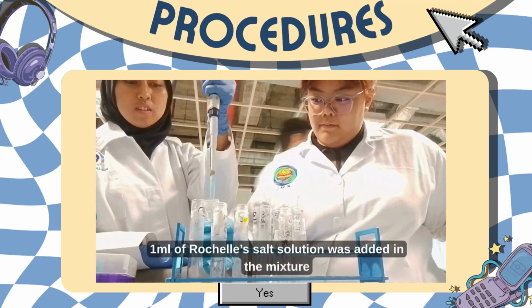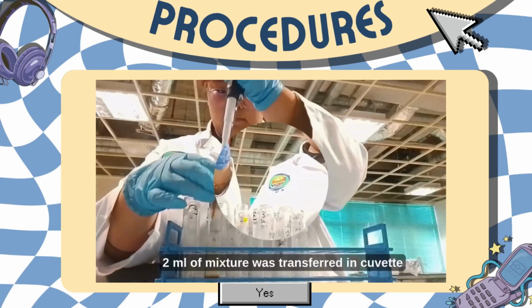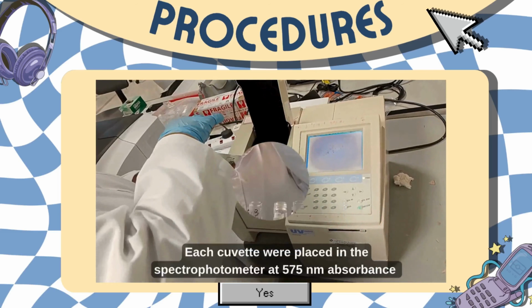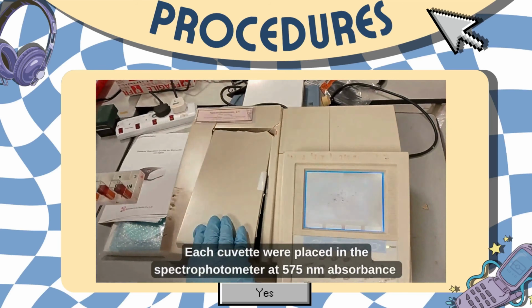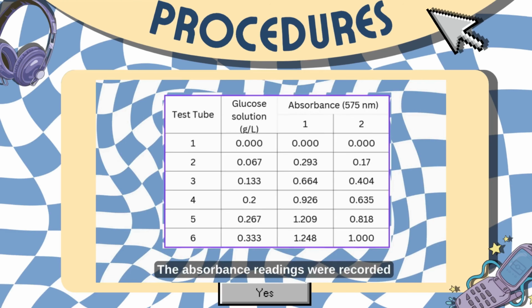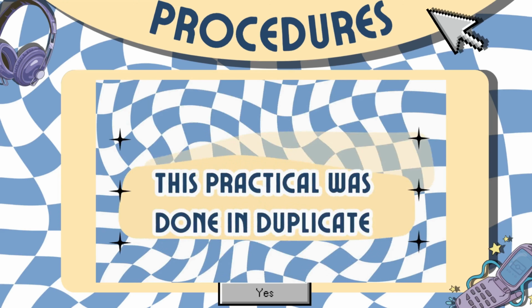After cooling, 1 ml of Rochelle salt solution was added in the mixture. 2 ml of each of the mixture were transferred in a cuvette. Each cuvette were then placed in the spectrophotometer at 575 nanometer absorbance. The absorbance readings were recorded, and the graph of the absorbance against glucose concentration were also plotted. This practical was done in duplicate.